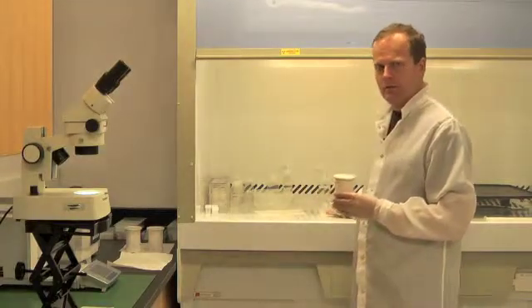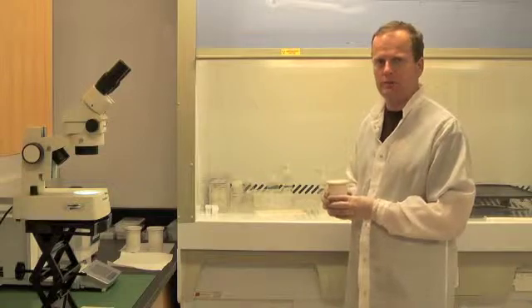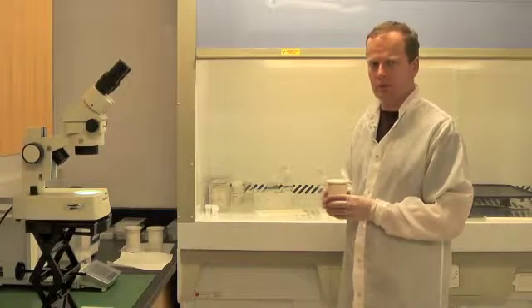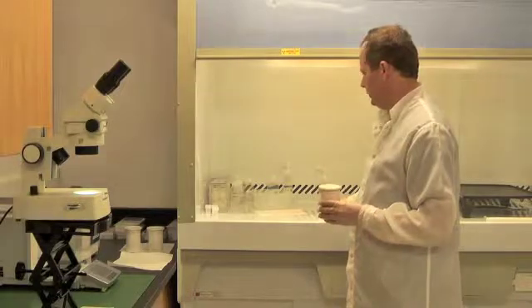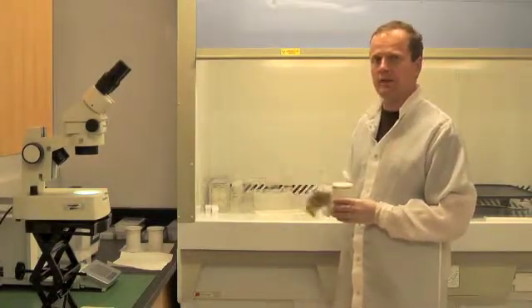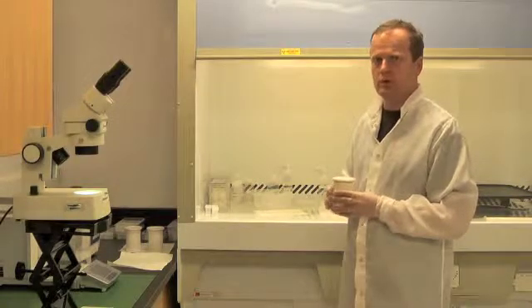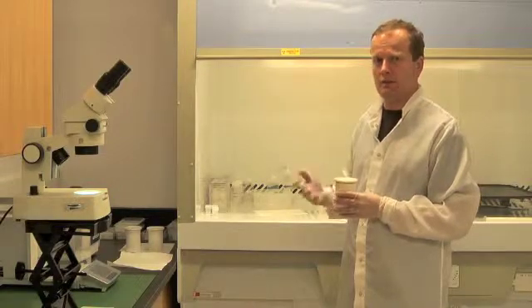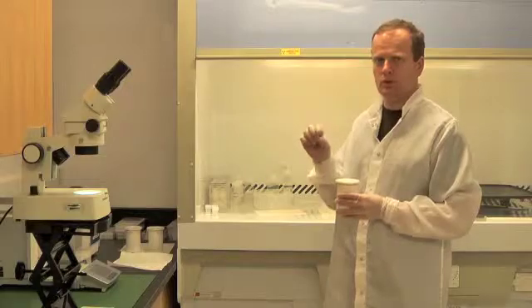We're going to dump the contents of the microcapsules back into these beakers that we used yesterday to do our initial washing of the zircons. And then we're going to rinse those zircons in the beakers, put them in the sonic bath, and then on a hot plate for 30 minutes each. This will remove the portions of the zircon that has dissolved during the chemical abrasion and leave us with a residual crystal that can then go on for dissolution.